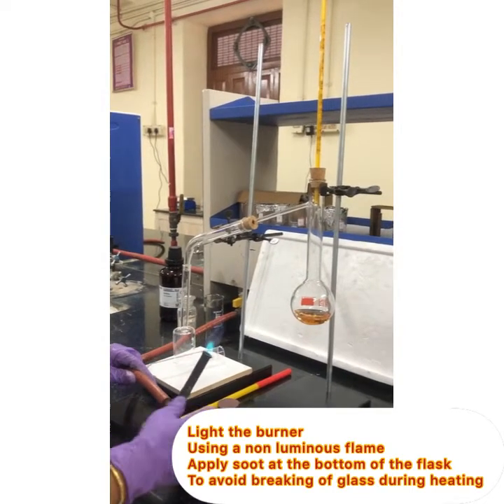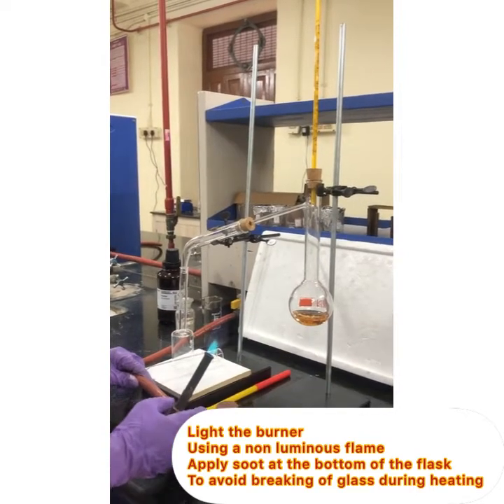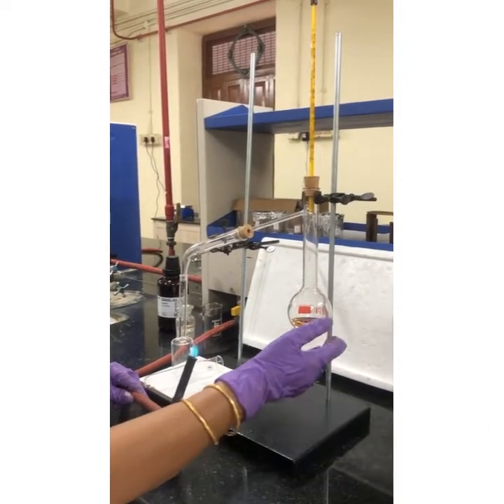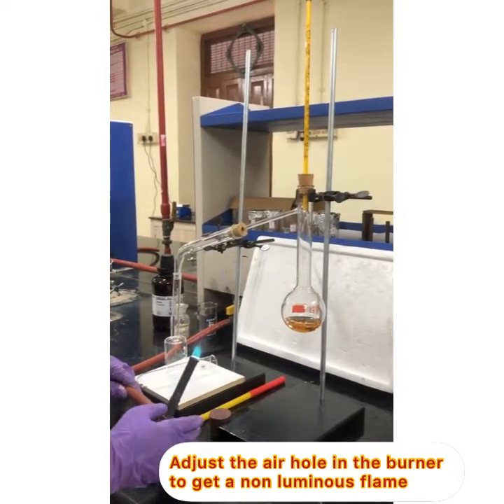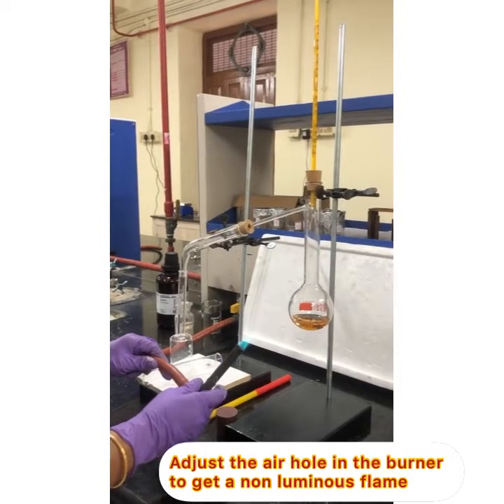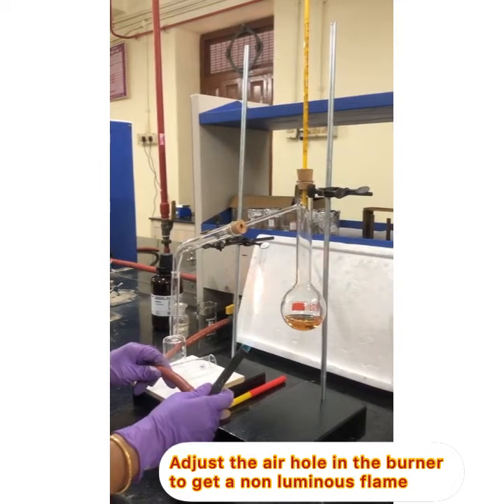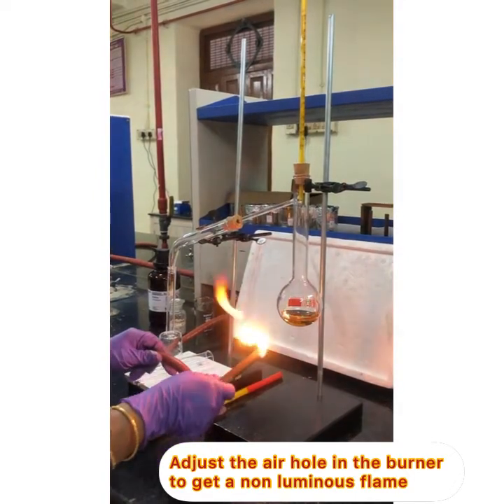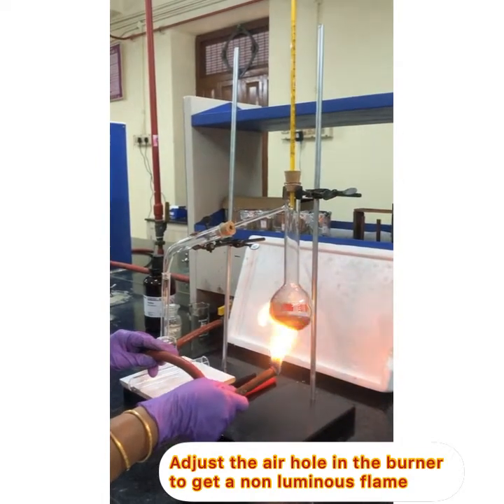First, you have to coat the bottom of the flask with soot so that the glass doesn't break when you apply high temperatures. Take a non-luminous flame, and in the burner close the air hole so that it becomes a luminous flame. For less than a minute, use the luminous flame to coat the flask, then slowly change it back to a non-luminous flame and start the distillation.